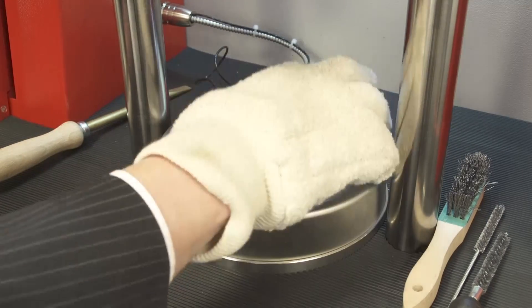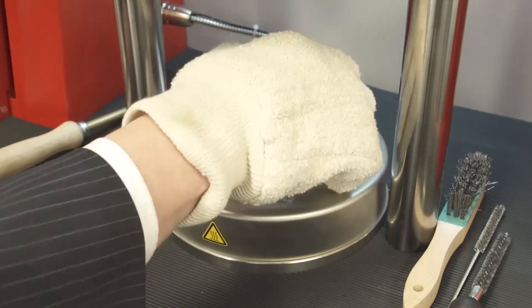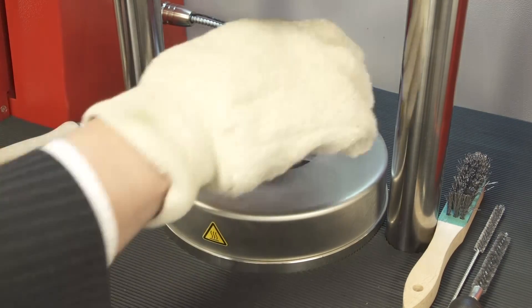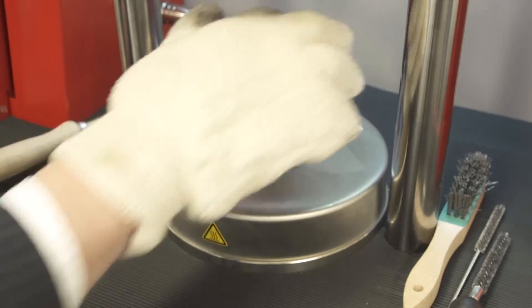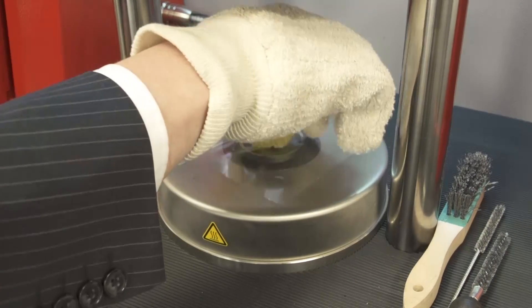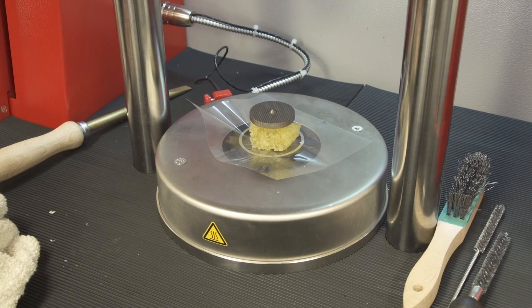Insert the rotor into the central shaft. Make sure that it is correctly inserted with the square completely in the drive shaft. Never close the machine with the square not correctly inserted. Always make sure the rotor is correctly put in the drivetrain.